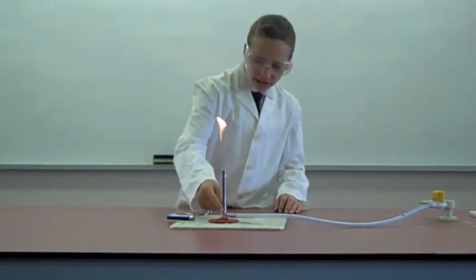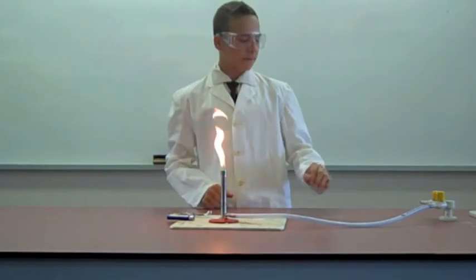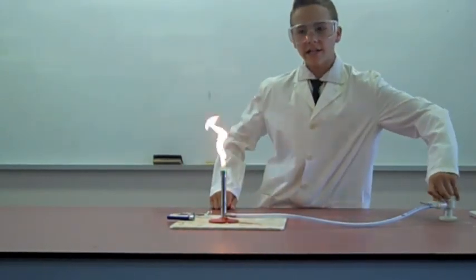After that, adjust the Bunsen burner so the collar covers up the holes, and turn the gas off.